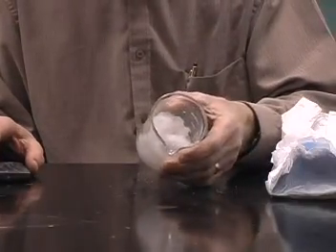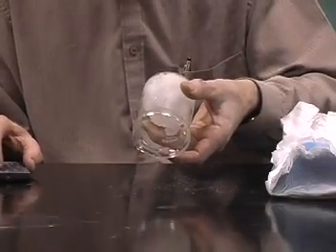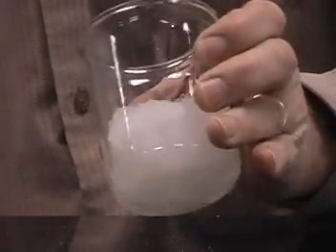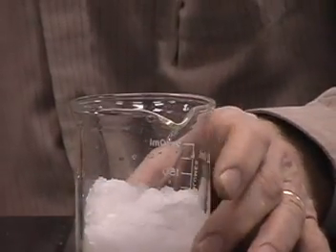Notice that after standing for about two minutes, all of the water is absorbed and we have no longer any liquid water present. It's all absorbed in the absorbent material.